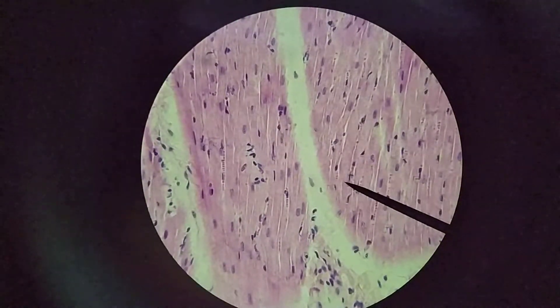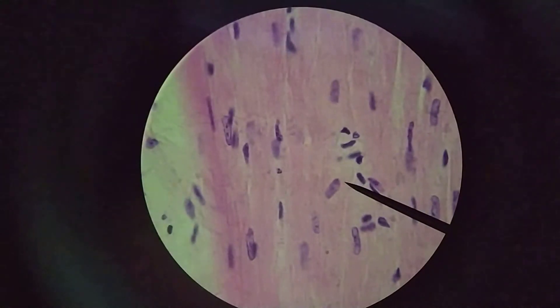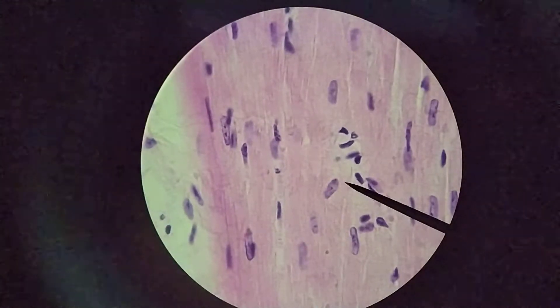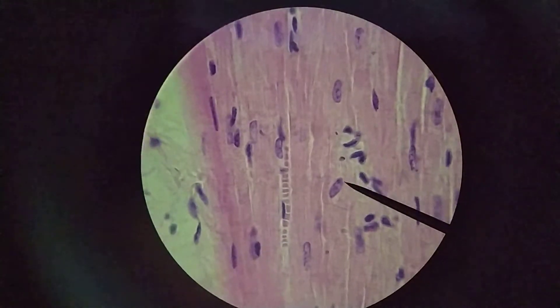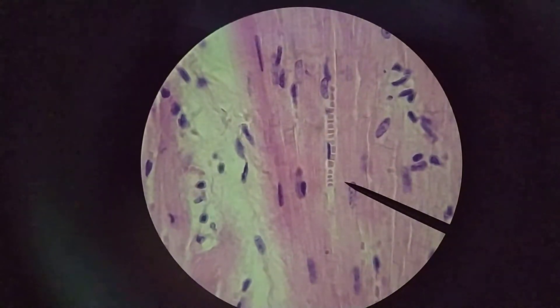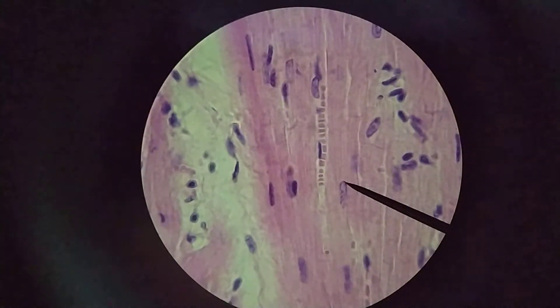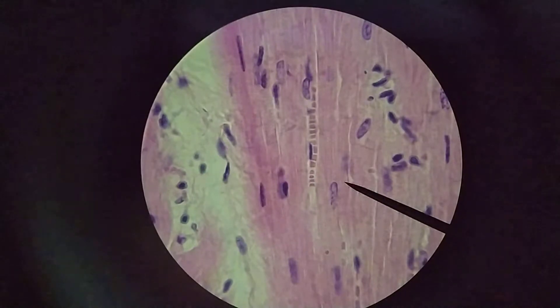Let's zoom in on some of these cells to get a better view. Let's go up to 1000x. Right here you can see a nice capillary right there in between a couple of muscle fibers. Here's one nucleus and one fiber — a central nucleus. Here's one edge, and the other edge is right next to those red blood cells. So you can see a central nucleus.